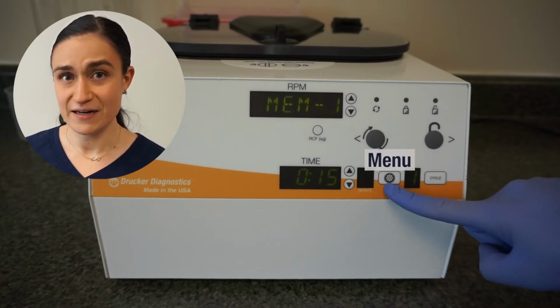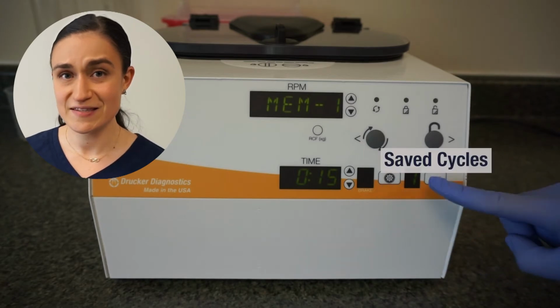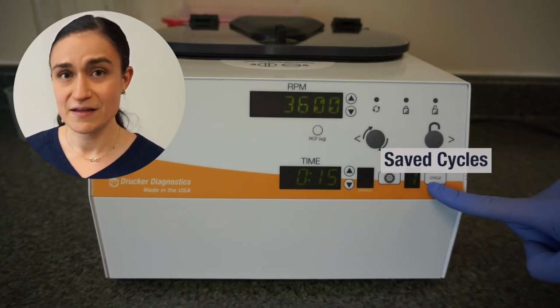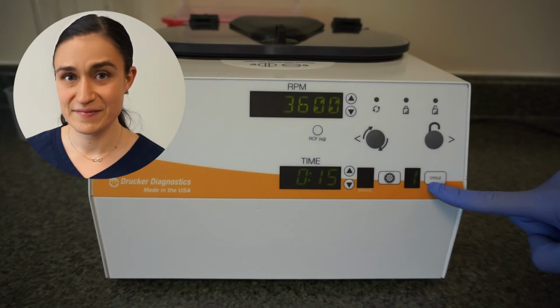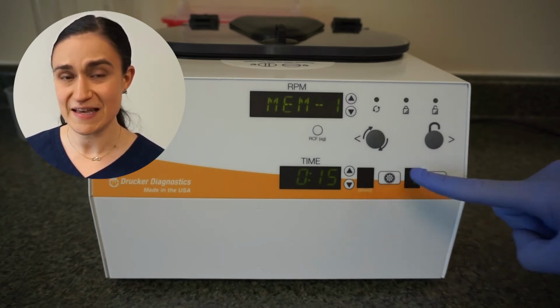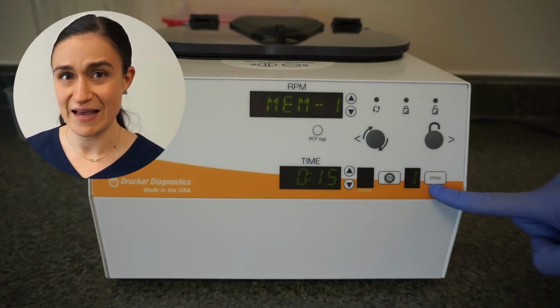The Menu button helps us navigate through the advanced menu, and the Cycle button, which will help us enter the menu, select our cycle, and save a new cycle. Today, we're going to be focusing primarily on the Menu button and the Cycle button, as they'll help us get to the point where we can change the name on our previously saved cycle.